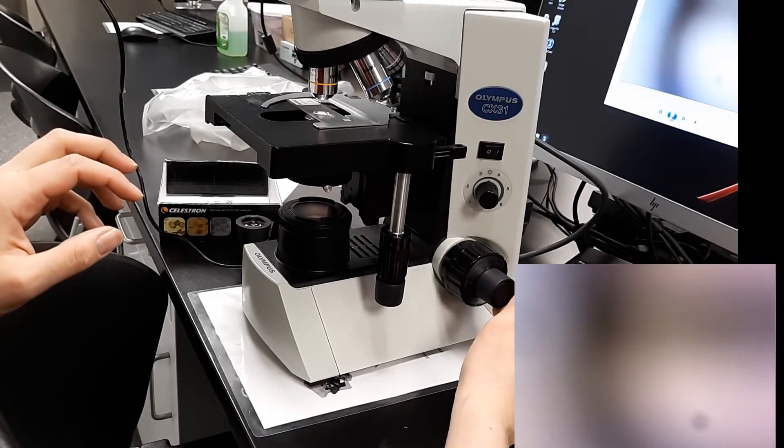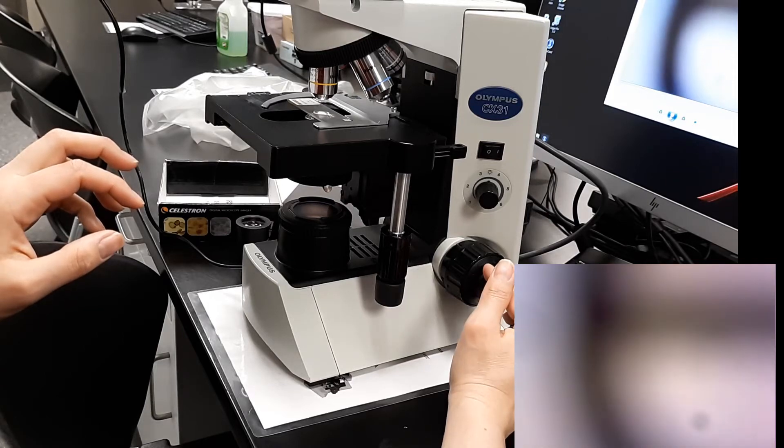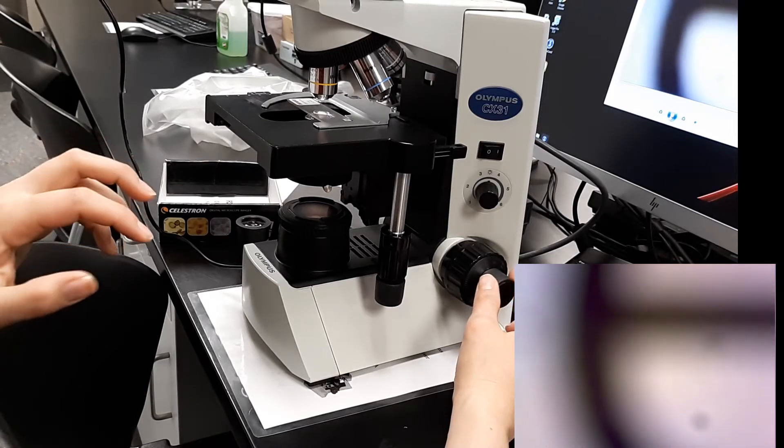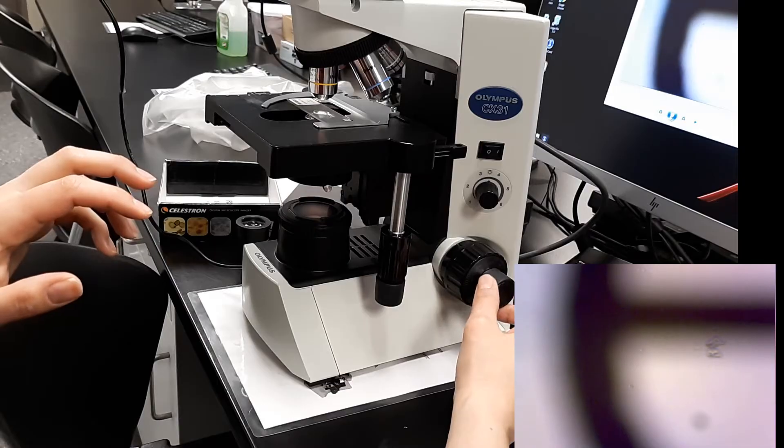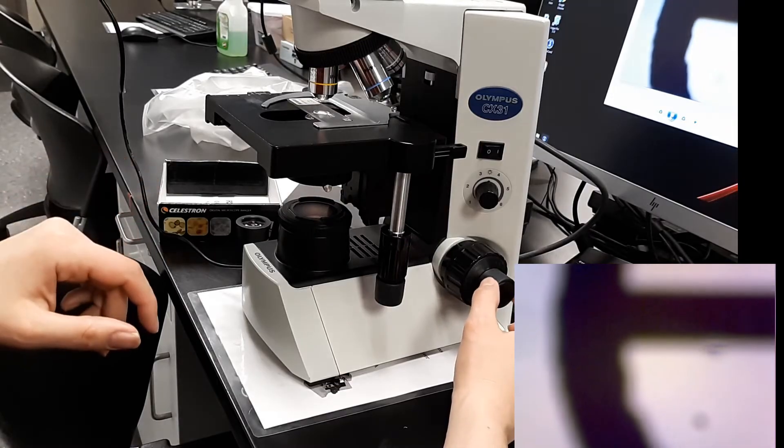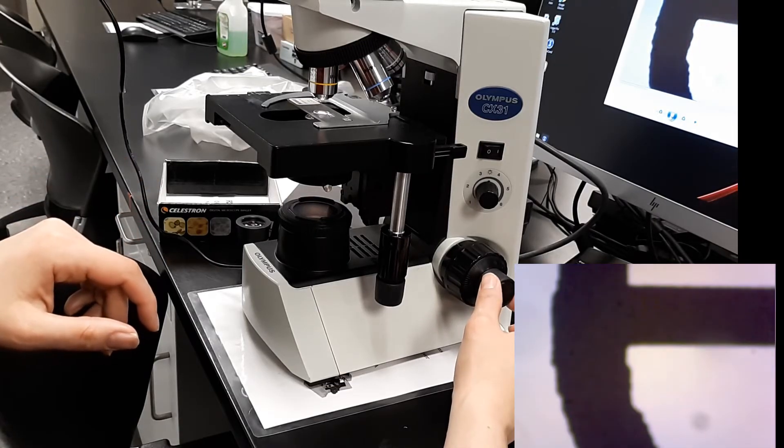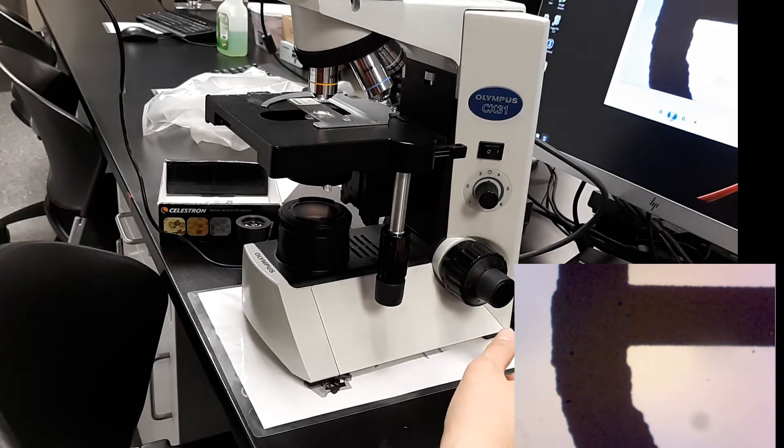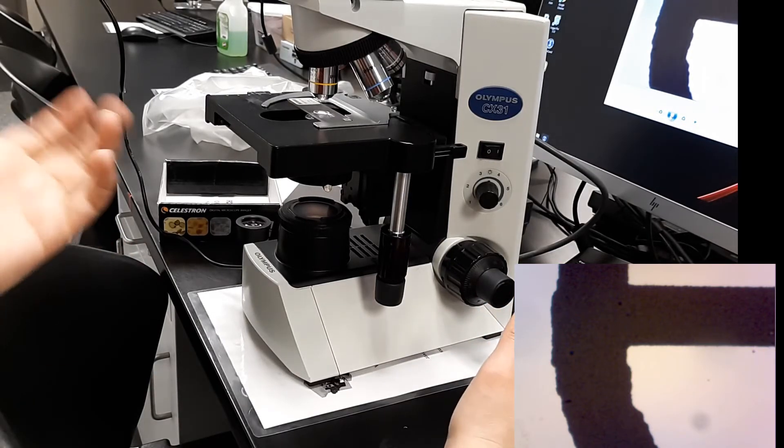So I'm going to rotate. In this case, I'm rotating away from myself. That's bringing this item into view. You may not always rotate away from yourself, sometimes you rotate toward you. That's just depending on the size and the thickness of certain specimens. So now this is nice and crisp and beautiful.